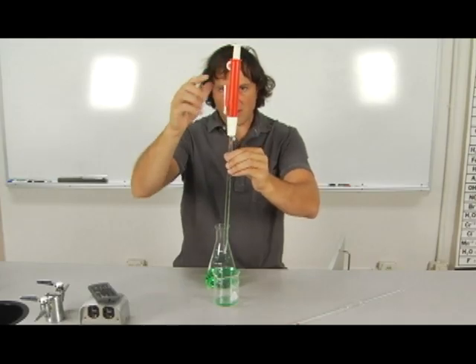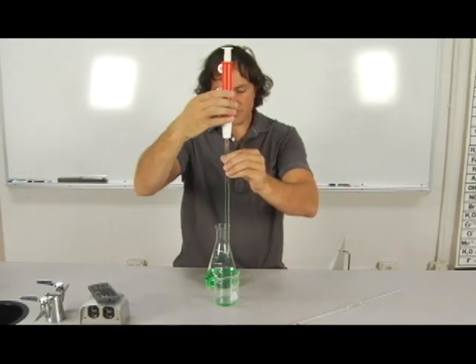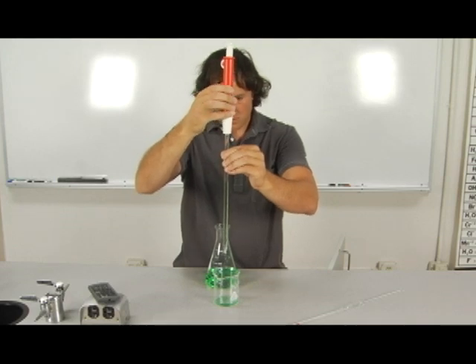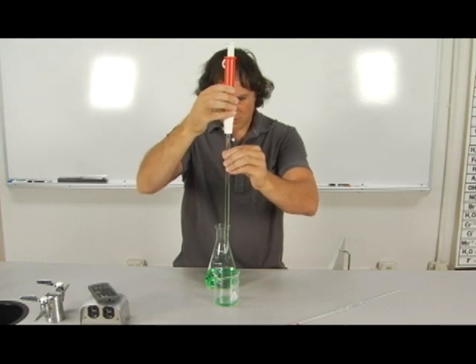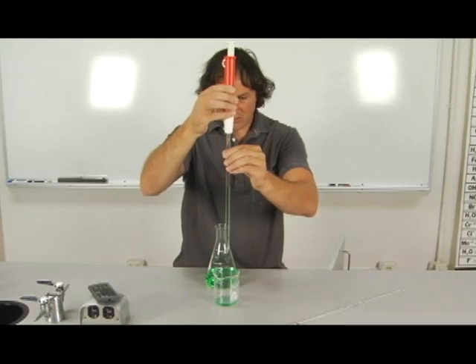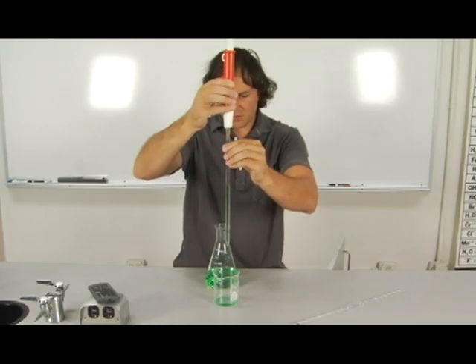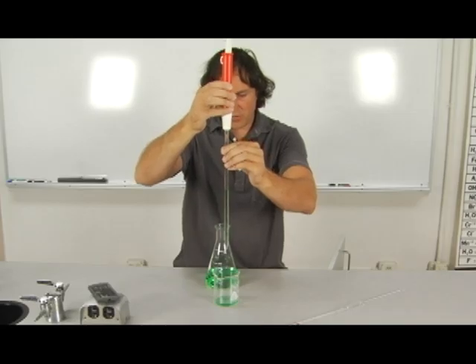So again, I'm using the outlet valve and not my thumb valve to drain the fluid. So let's say I wanted 4.3 milliliters. So I drained this down to 5 since I'd already started out with 0.7 milliliters.